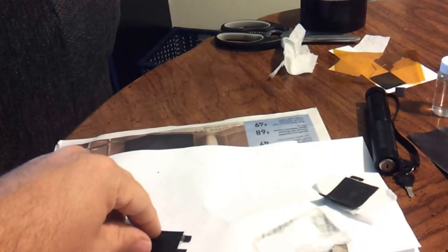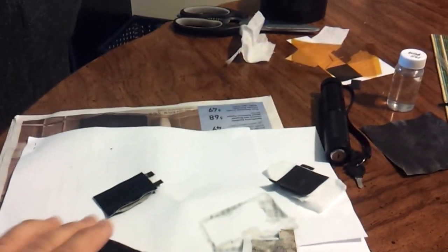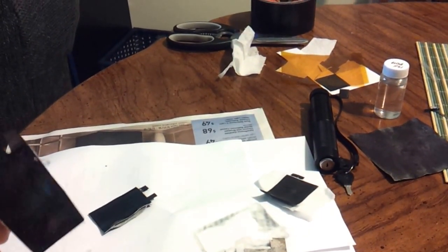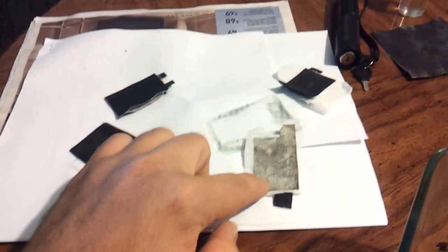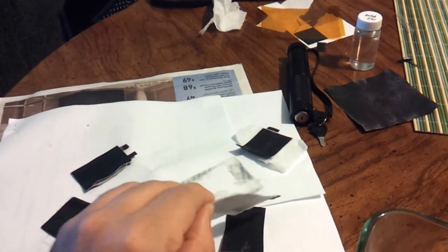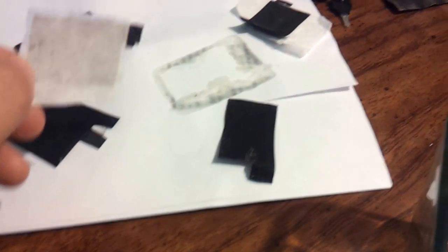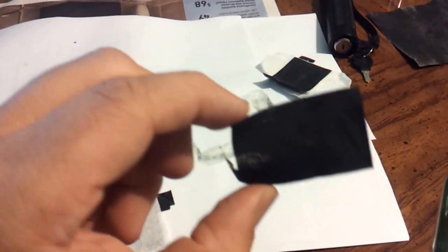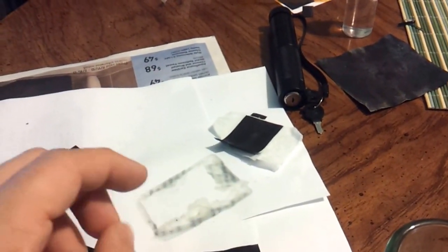I used a tape to put this one together. This one is the PVA, and it still doesn't dry. I even went so far as putting a tissue laminate between it. This was a paper experiment to see if I could grow the graphene on the paper. And well, there it goes. It broke apart. This actually is a graphite that I used first to laminate the paper and then grow the graphene on it. And the ohmmetric tests were pretty good, but still nothing.